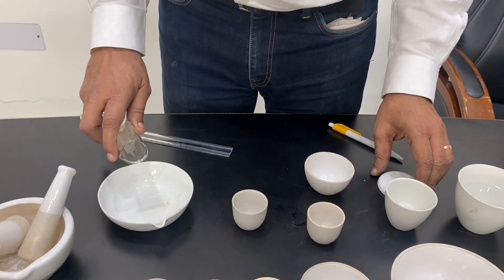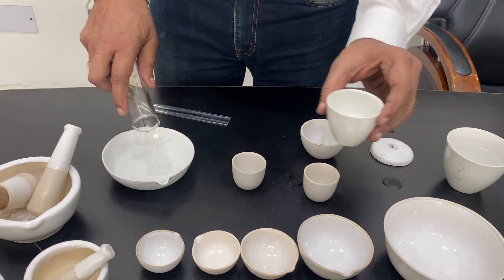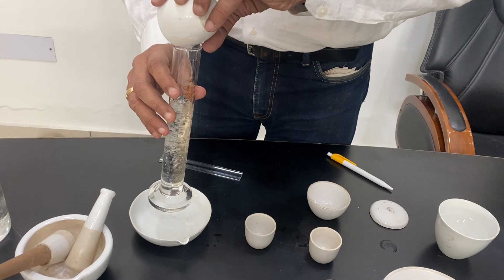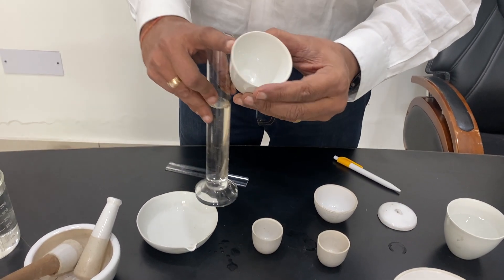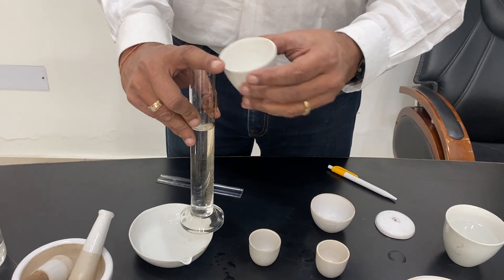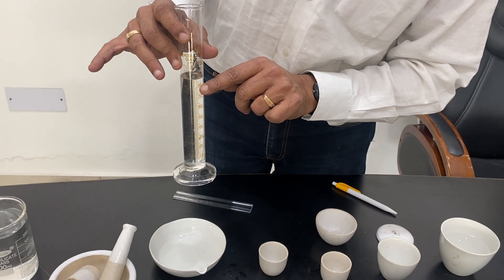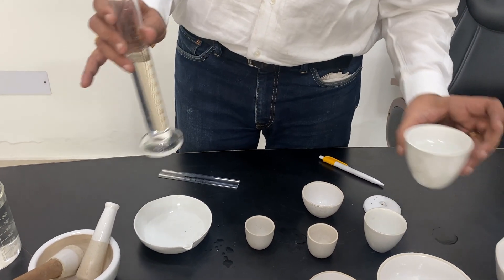And another one I can show you — this one is 80 ml. This does not have a lip, no lip. Only glazed outside, glazed inside, and glazed lip also. This comes to about 80 to 85 ml.